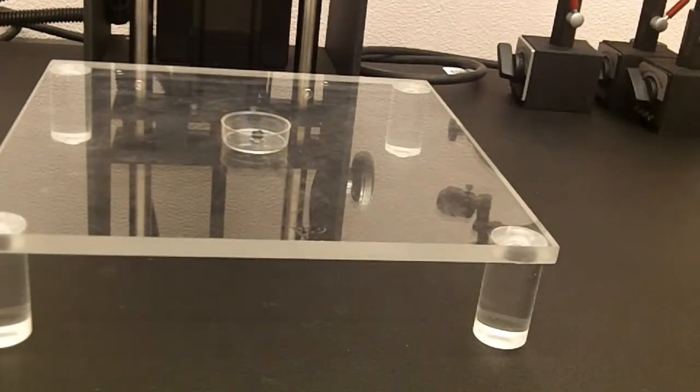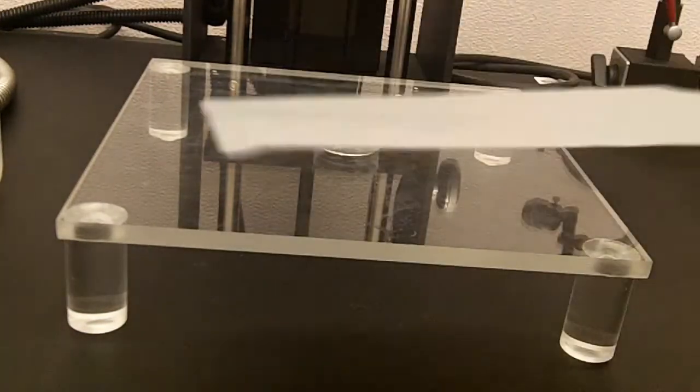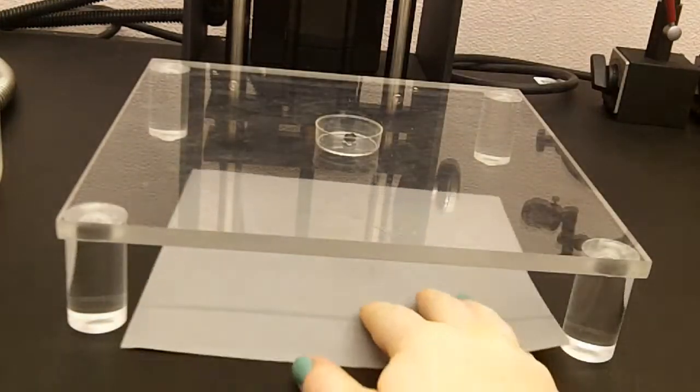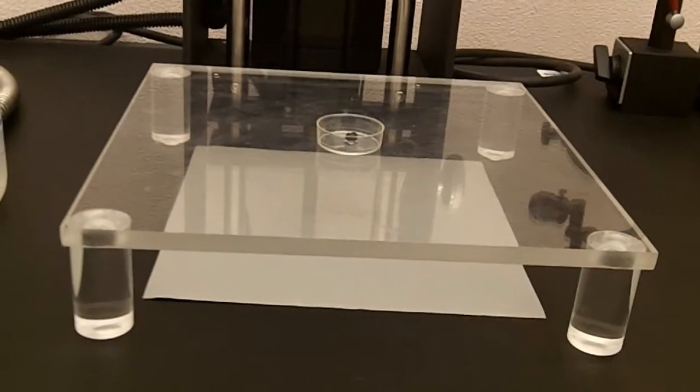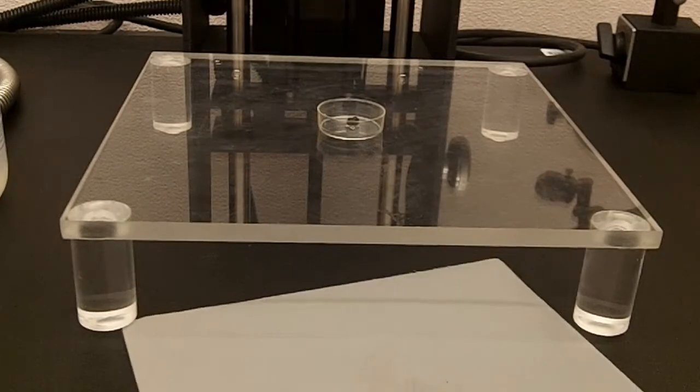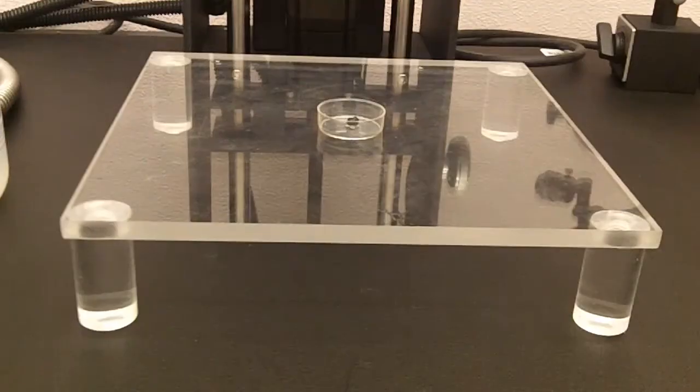And when you are imaging ethanol specimens, you do not want to put your paper directly underneath the petri dish, because spilling the ethanol is inevitable, and you really don't want to get any ethanol on your paper. So here is one where you've got some ethanol spilled and it's stained the paper, which really cuts down the amount you can use that paper.